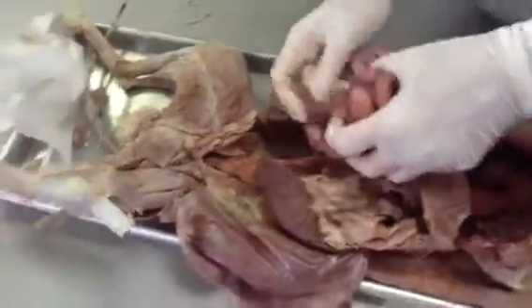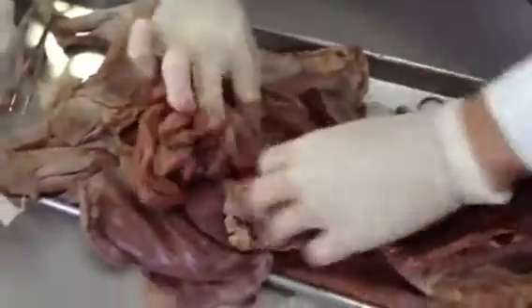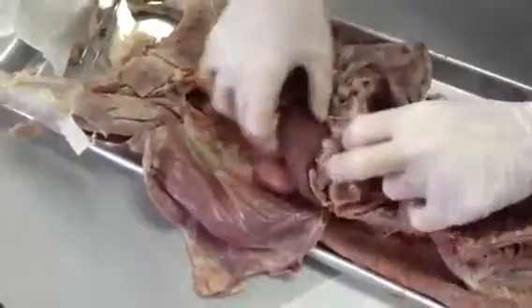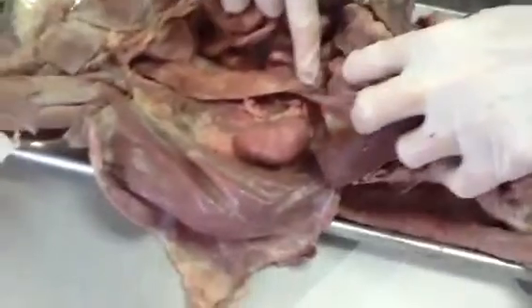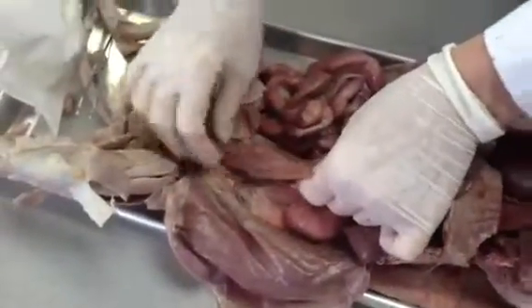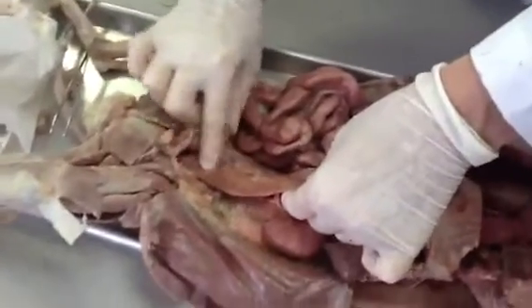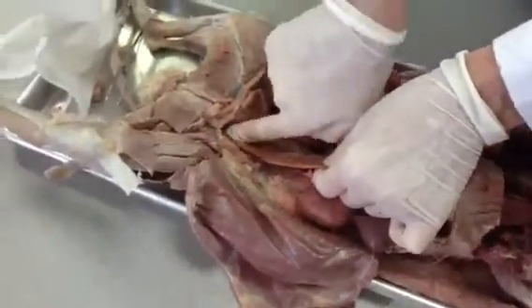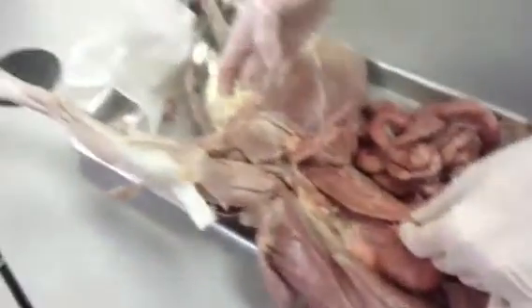It's going to move into the large intestine. You have an ascending large intestine, a transverse, I can't remove the peritoneum. Transverse here, coming again underneath here, transverse, and then descending large intestine. This is where absorption of water and some electrolytes occurs. The food bolus then gets harder and harder until it passes into the rectum and out the anus.